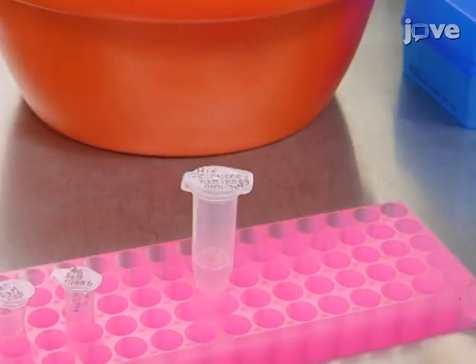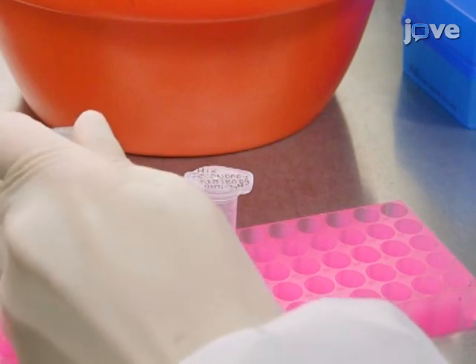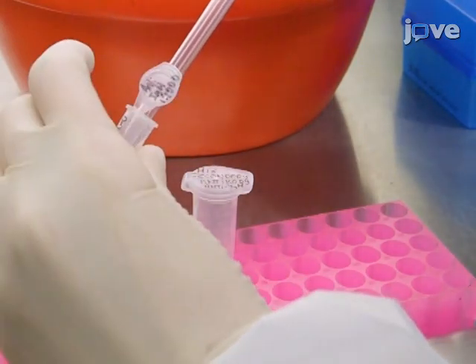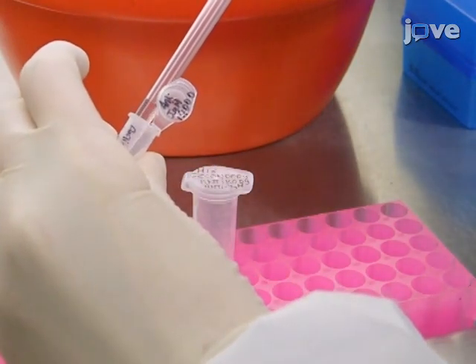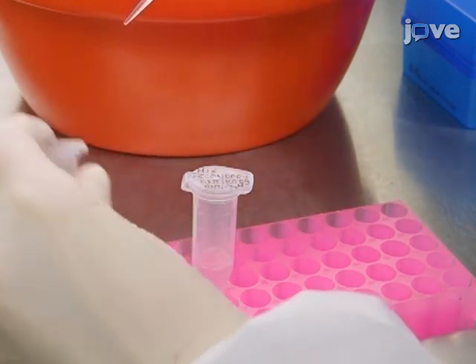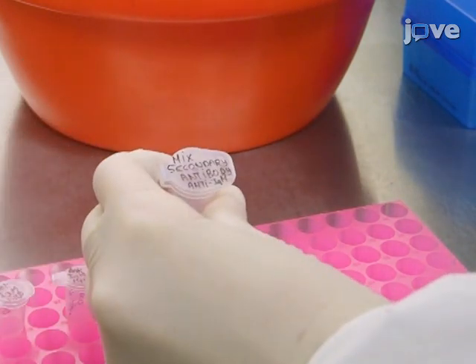Dilute the secondary antibody in the staining buffer. Use anti-human IgM fluorochrome conjugated antibody or anti-human IgG fluorochrome conjugated antibody at a dilution of 1 to 5,000 in staining buffer.